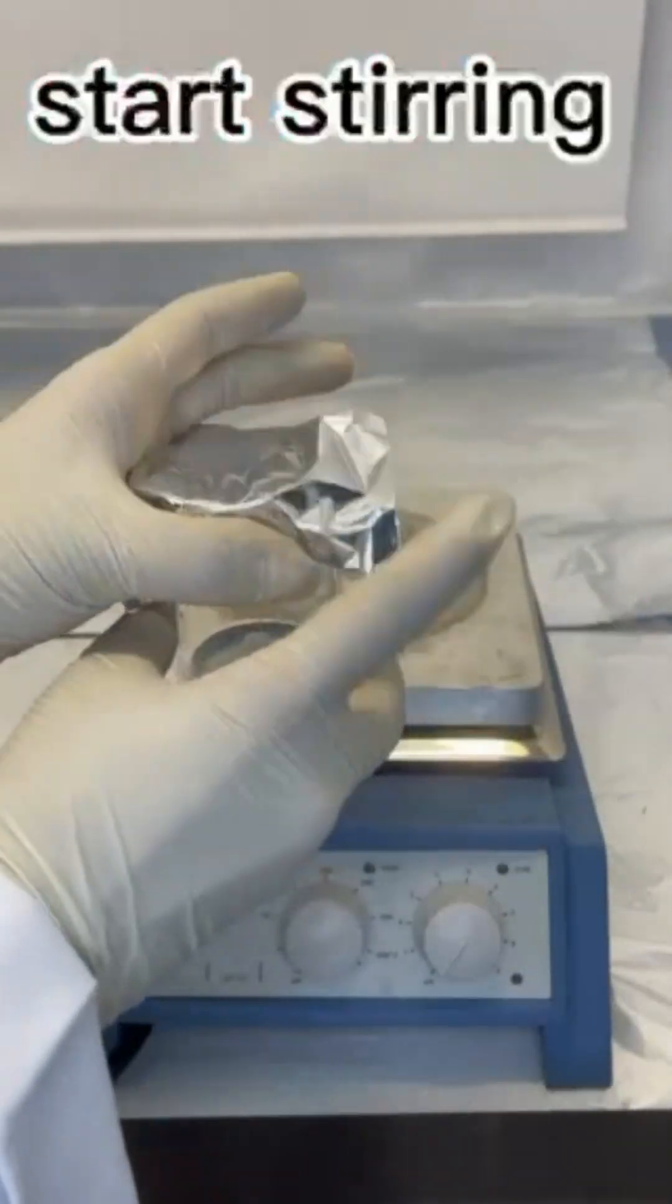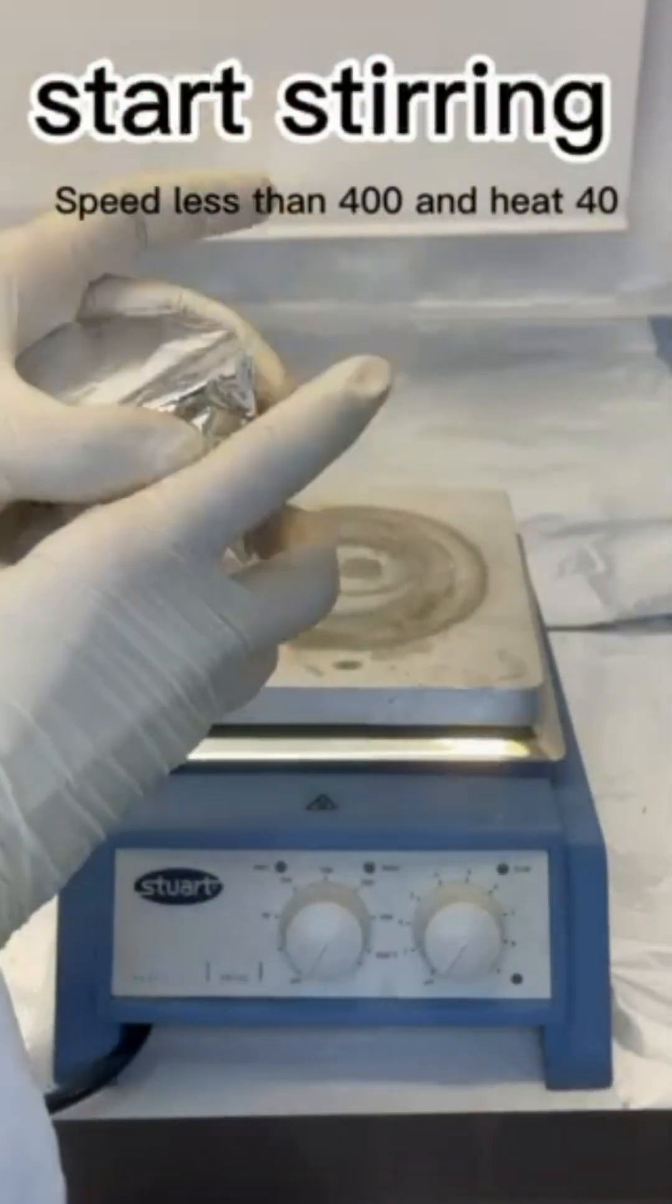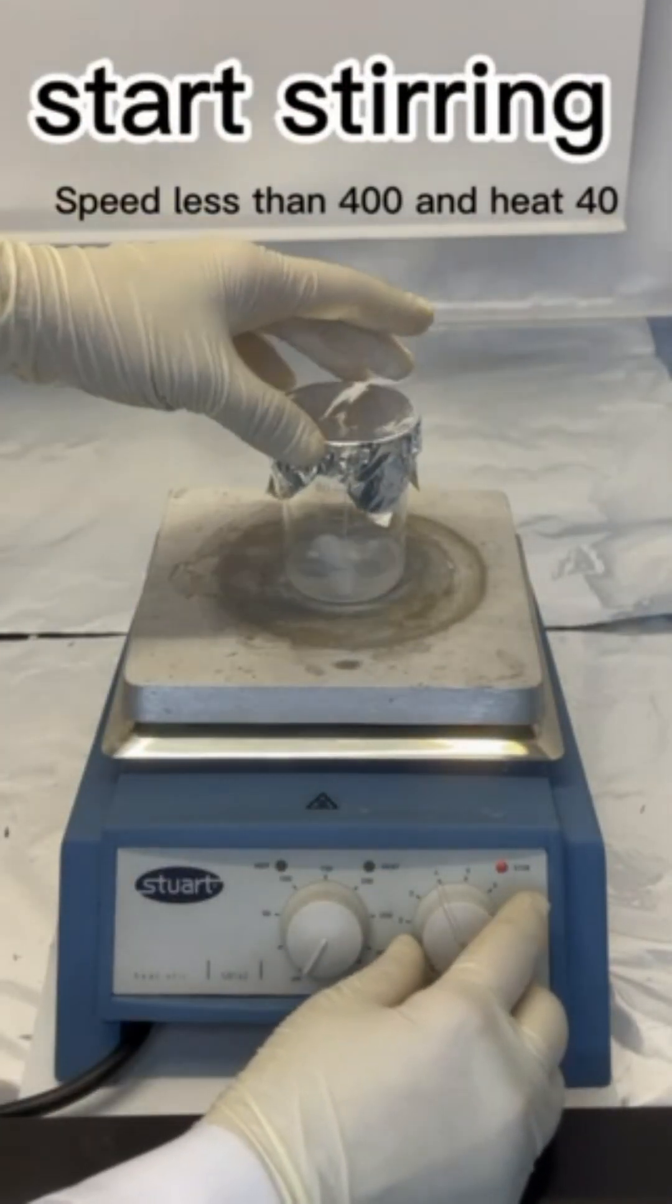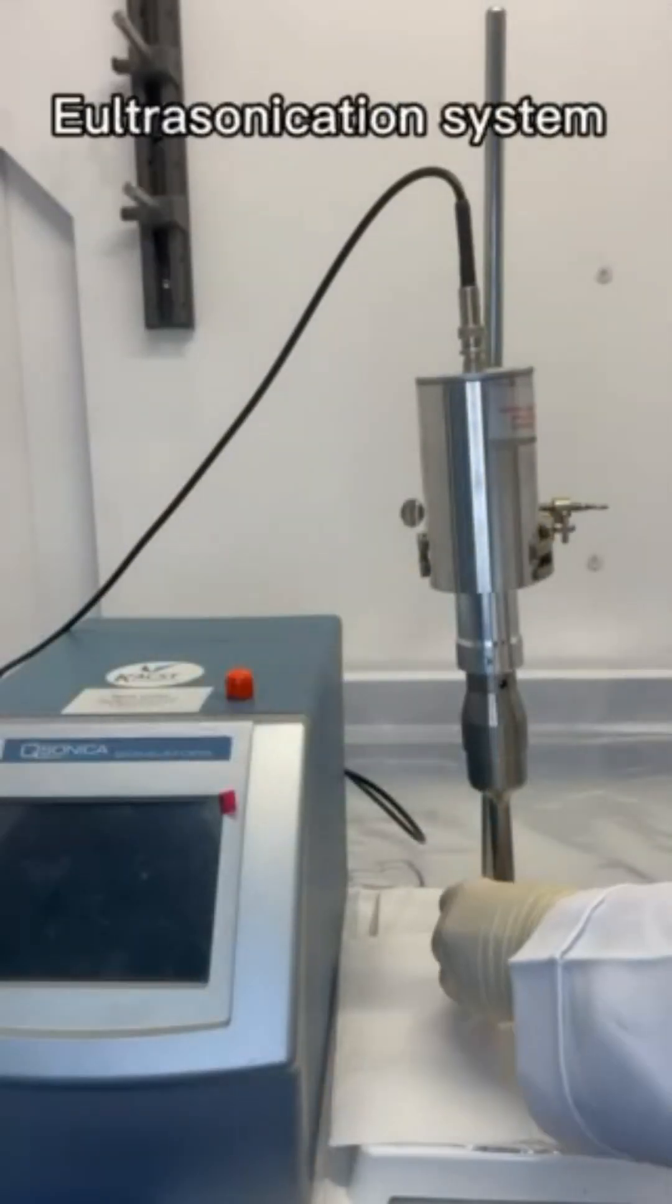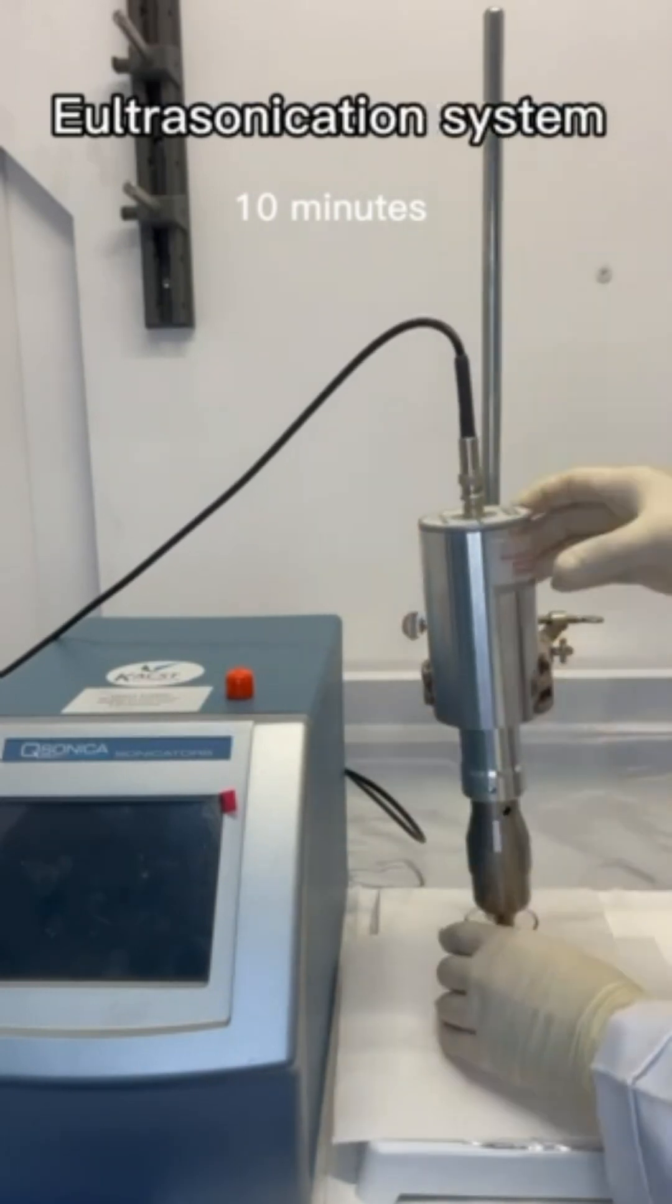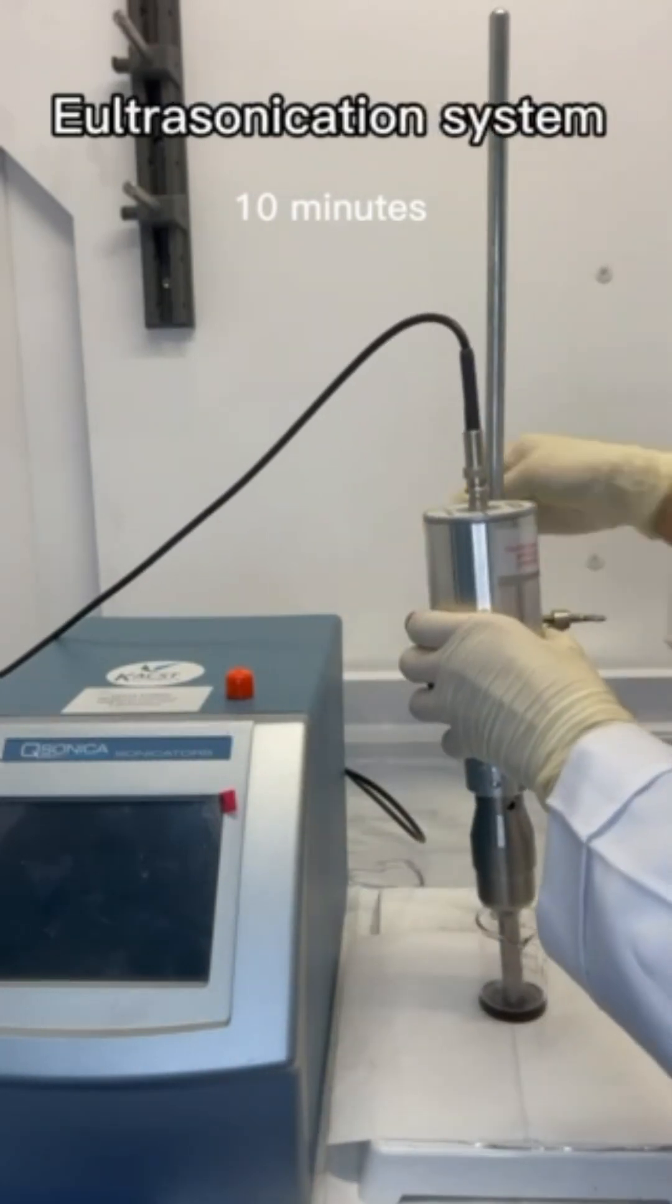Put the polymer solution to stir for an hour at temperature of 40 centigrade to dissolve, and for the filler solution we used ultrasonication system.